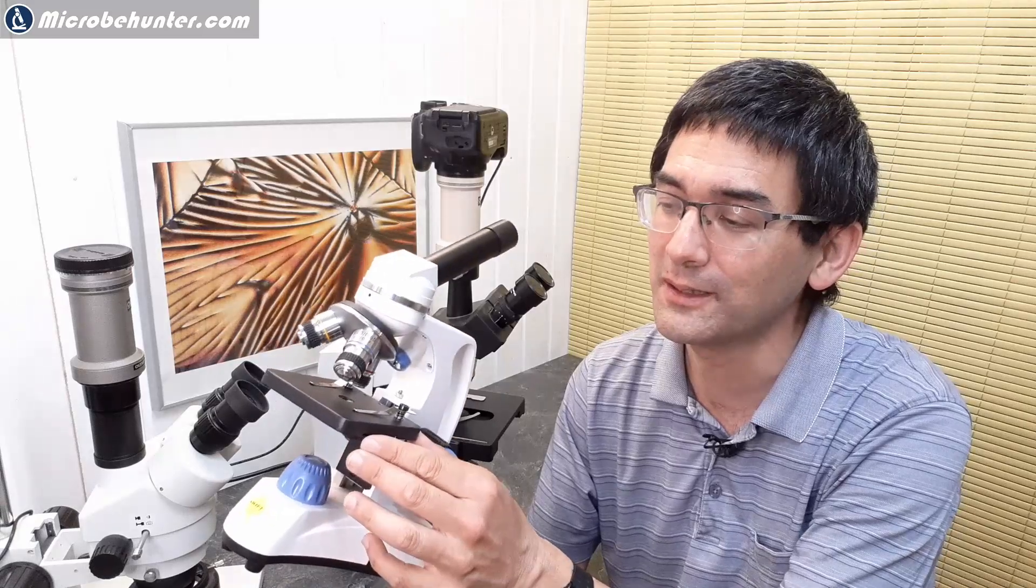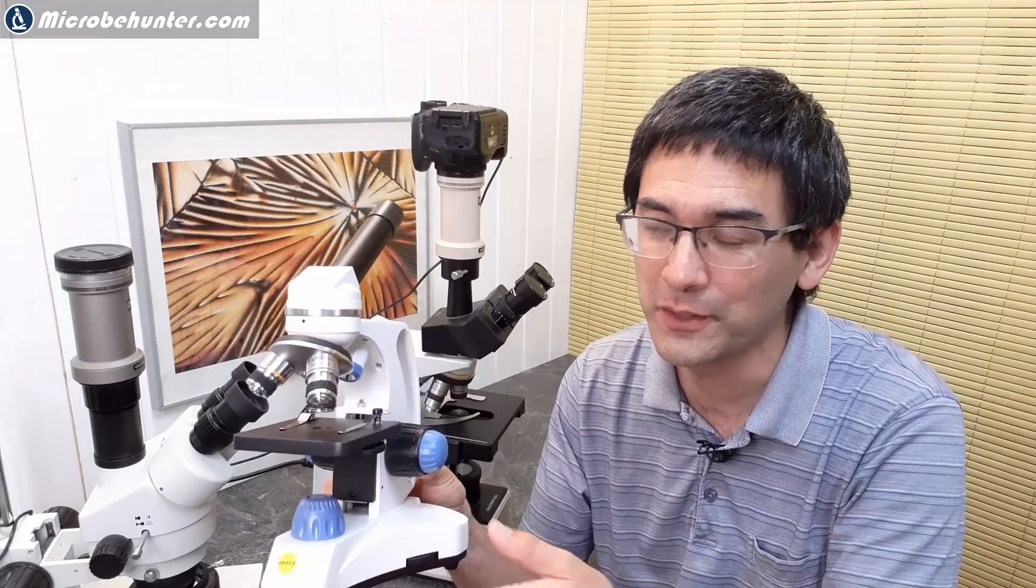It is an introductory microscope but it can do more than you might guess because it's easily possible to upgrade it to polarized light microscopy and in this video I'm going to show you how you can do that.